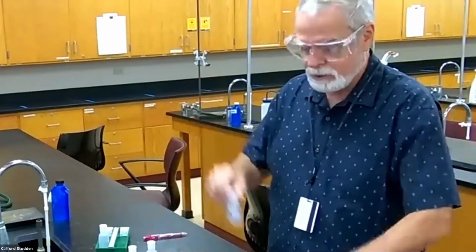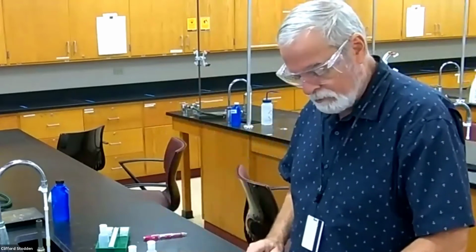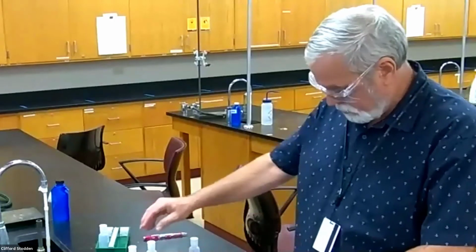All right, now I'm down to barium chloride, and I'm going to be adding some things to that. We've already added two solutions to it, or at least talked about it. Yeah, we've added calcium and copper. The next one that I could add to barium chloride is the aluminum nitrate. So that could possibly form aluminum chloride, so I'll do that one.